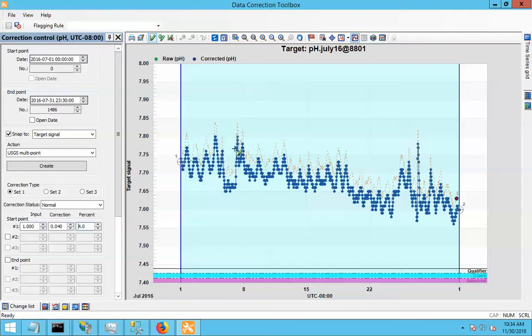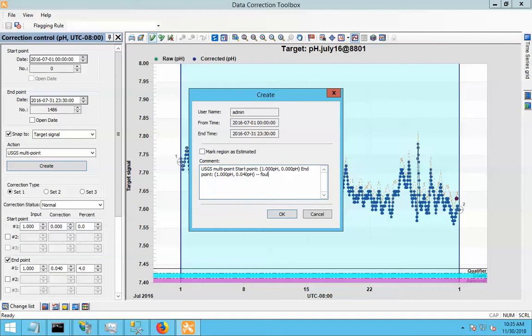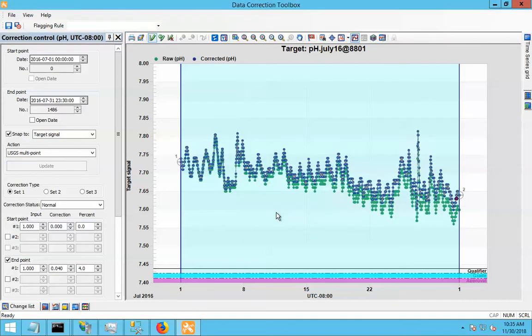Now, if I assume that at the start of my period my sensor was clean and reading accurately, there shouldn't be any correction factor at the beginning here. So what I'll do is something like this. That's to say, at the start of the period, start point, don't apply any correction, but at the end of the period, apply that much correction, endpoint. This is basically the same thing as doing a drift correction, but you can use the USGS multipoint to do those. I'll put that in. Okay.